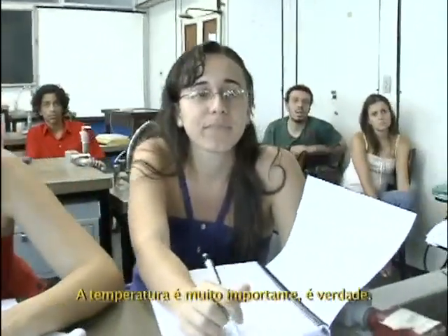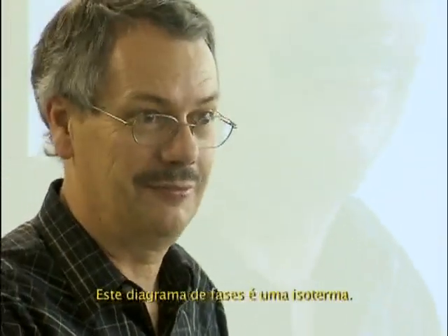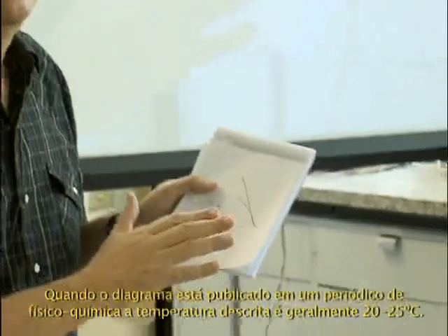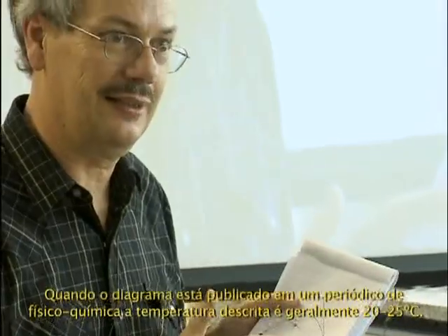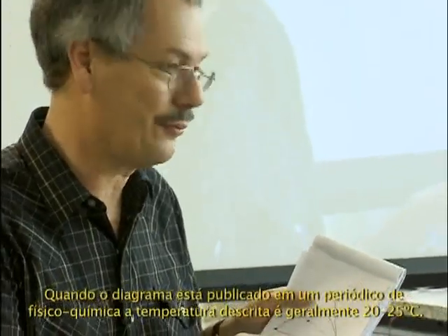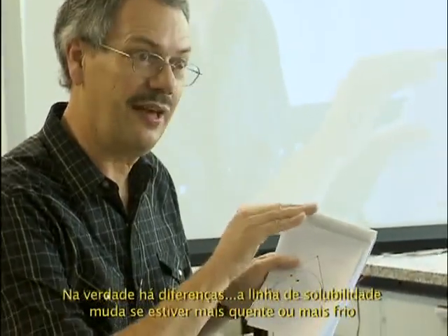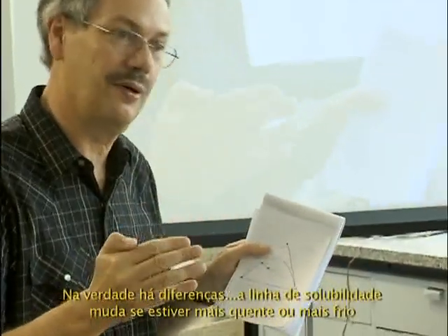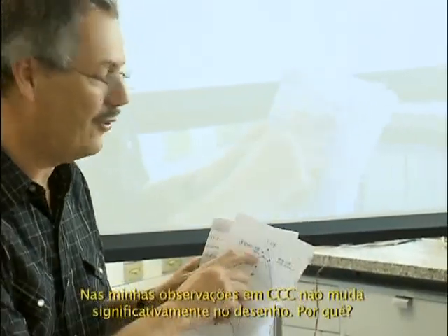The temperature is really important. That's true. This is an isotherm phase diagram. When it's a phase diagram published in a physical chemistry journal, it says temperature 20 degrees, temperature 25 degrees. You do have differences. The binodal line changes if it's warmer or if it's cooler. On my own observation in CCC, it doesn't change significantly on the drawing.